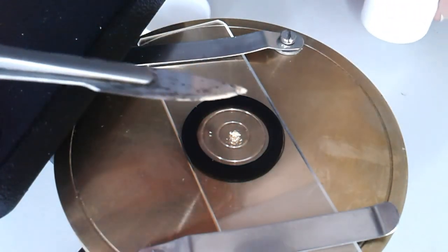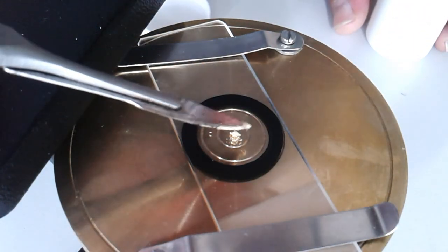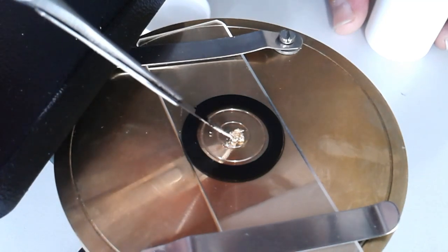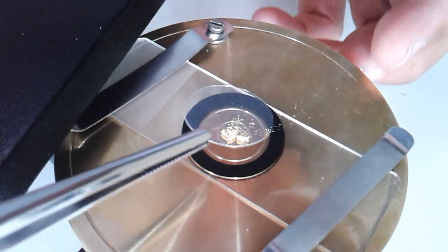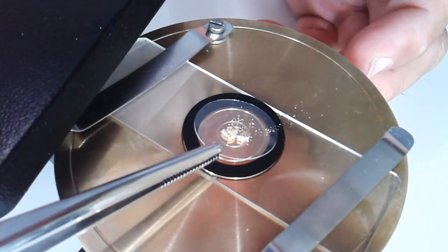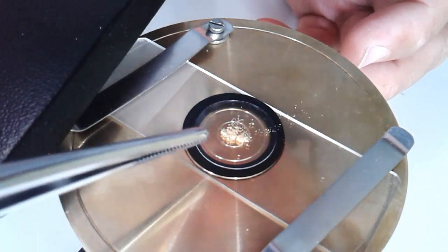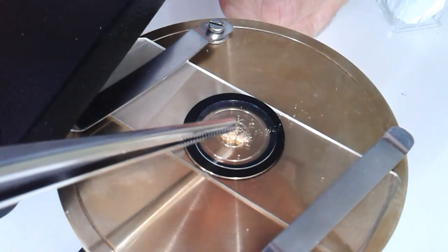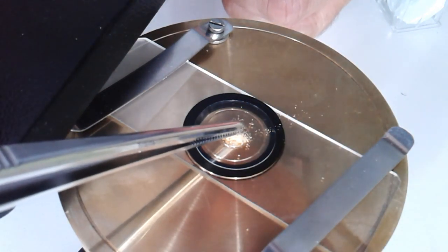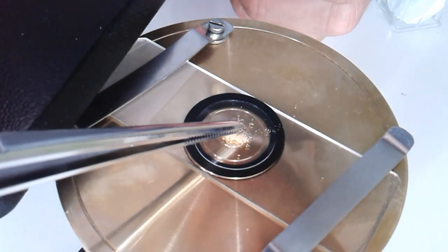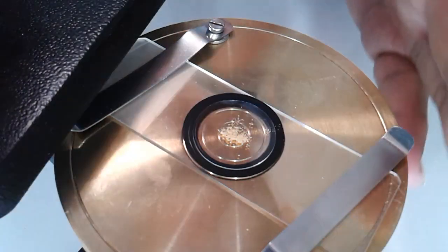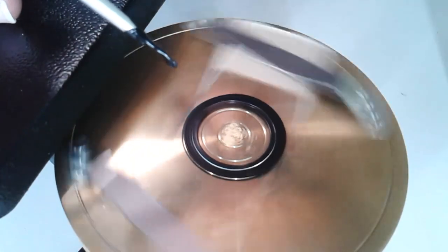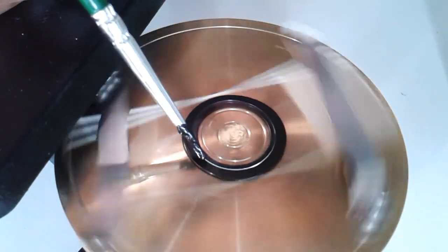Now some sample material, because I actually also want to try it out. This is pollen, spruce pollen, and I'm making a so-called dry mount. This means I'm not using any liquid mounting medium, but I still want to preserve them. I'm simply putting a round cover glass on top, pressing everything slightly flat a little bit, because I want to make sure that the round cover glass and the ring, the black ring, actually make good contact.